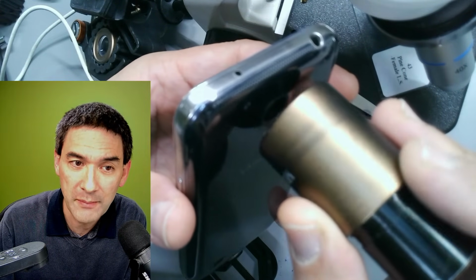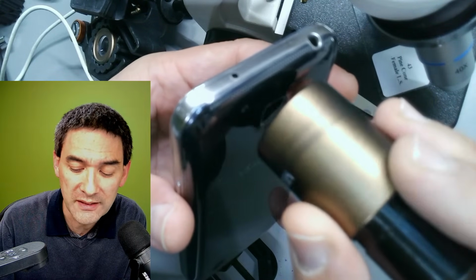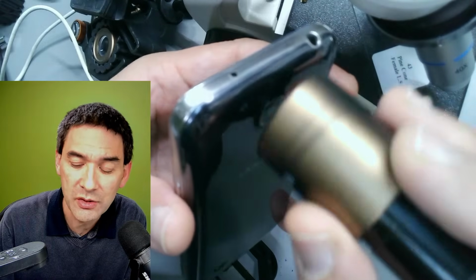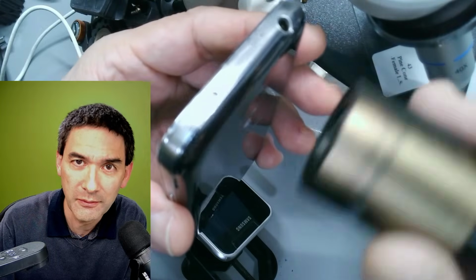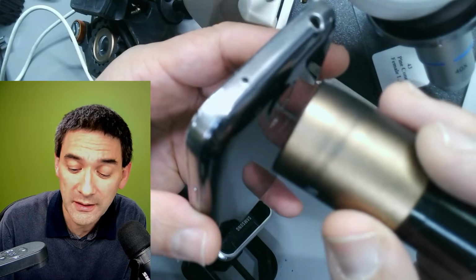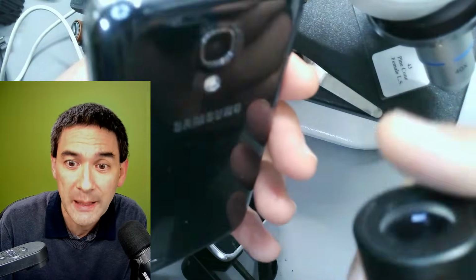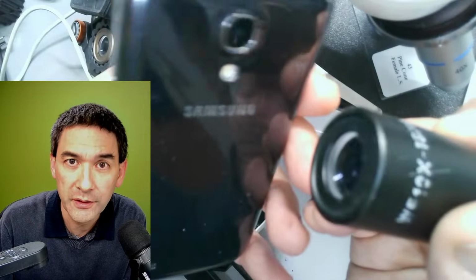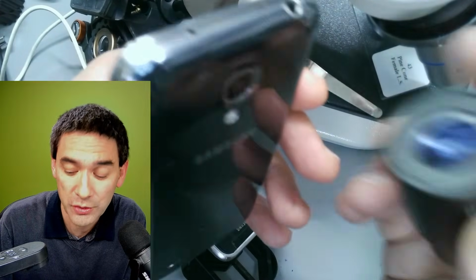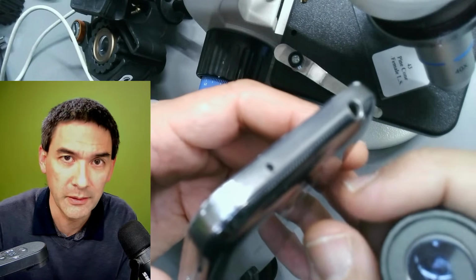The fourth dimension is the tilt in the x-axis, the fifth dimension is tilt in the y-axis. So you have to adjust six different axes to orient the camera over the eyepiece, and that's very challenging, right? For this reason, it's good to have an adapter that actually helps you to align the whole thing. And there are different approaches to do that, and I just want to show them to you. Some of the adapters that I have are pretty good, and some of them are not so good, right? I just want to give you an overview here.